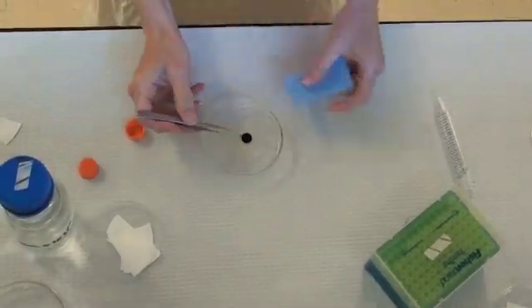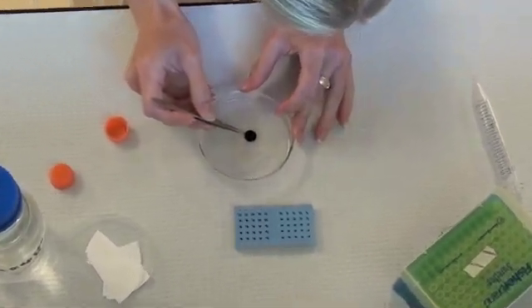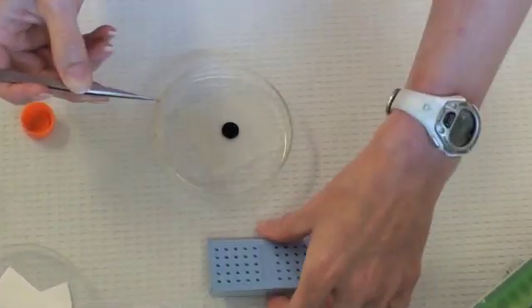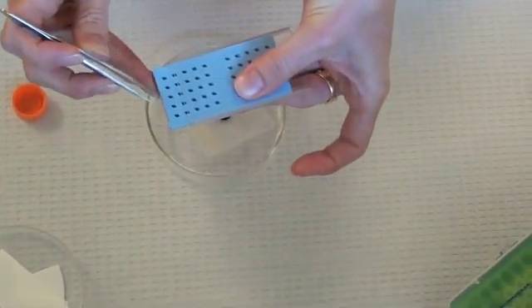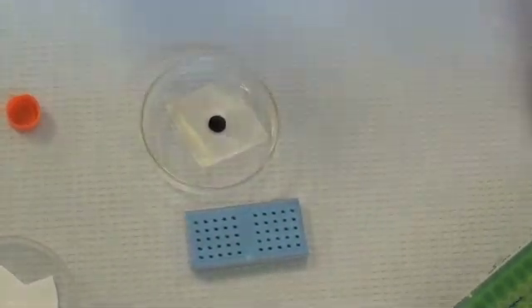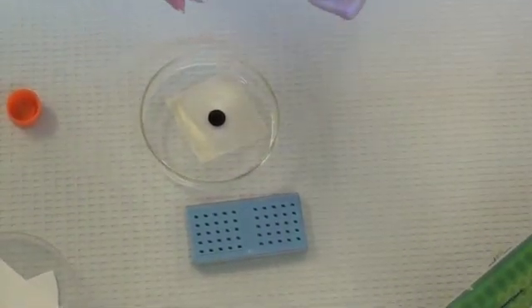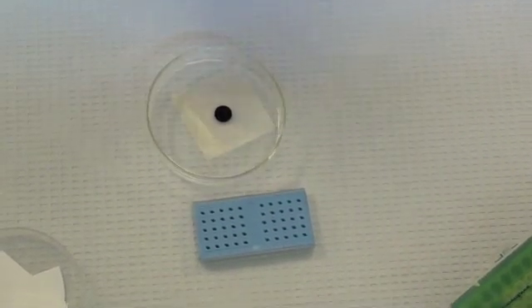When you're done preparing your sample, you'll remove the TEM grid from the PELCO tab and place it in the blue box for shipment to the EM facility. Notice how the grid is handled gently and placed in a specific cell in the box. You'll notice the instructor carefully puts the special forceps away in the containers so that those special tips don't get bent or damaged.